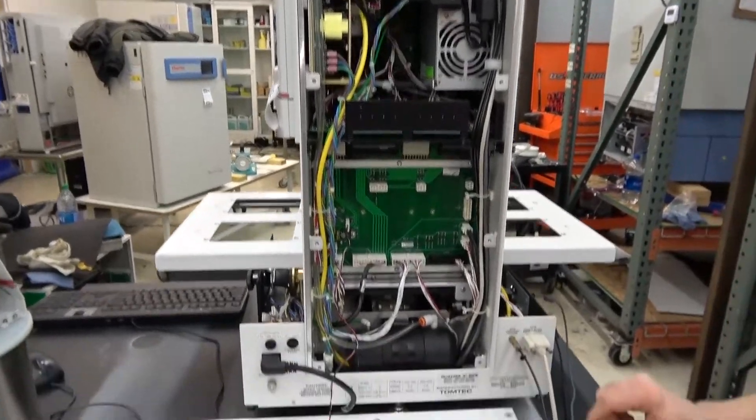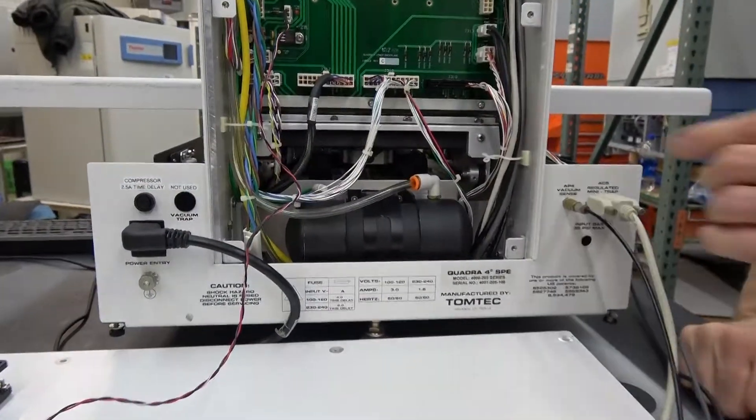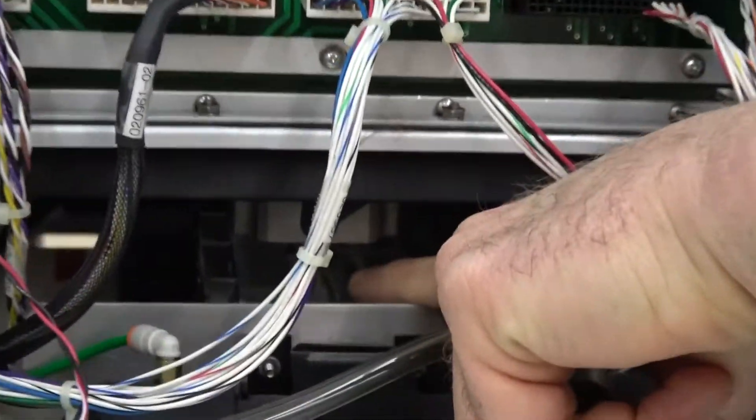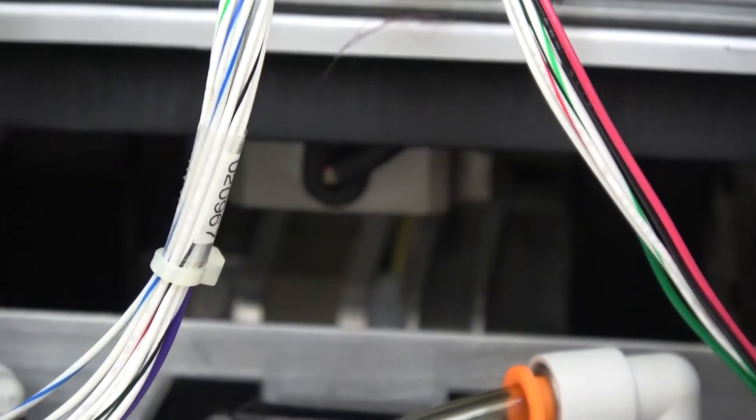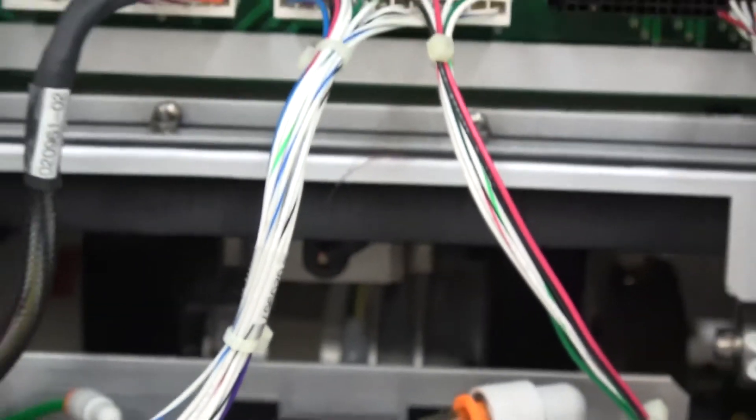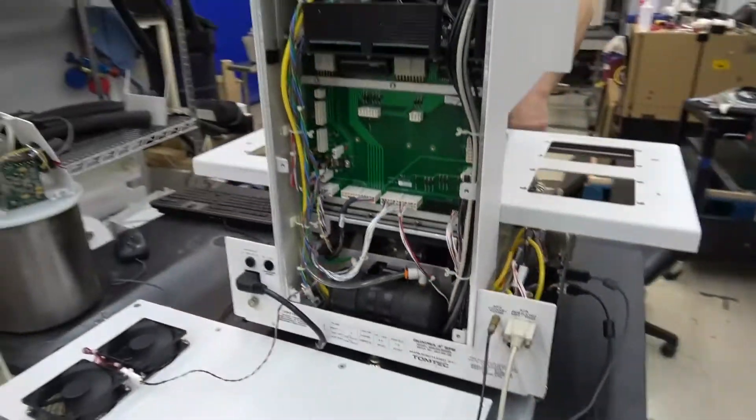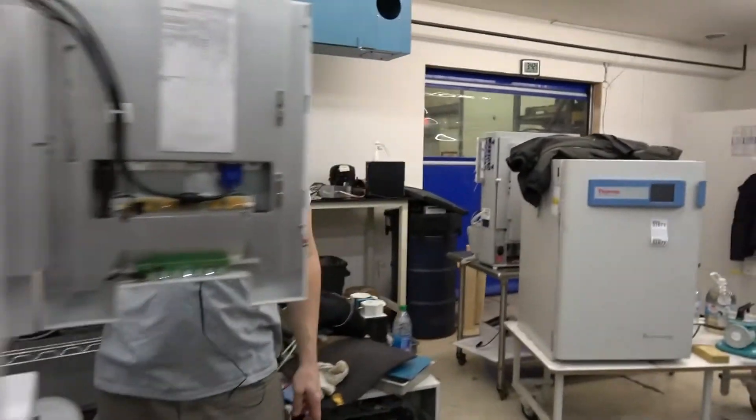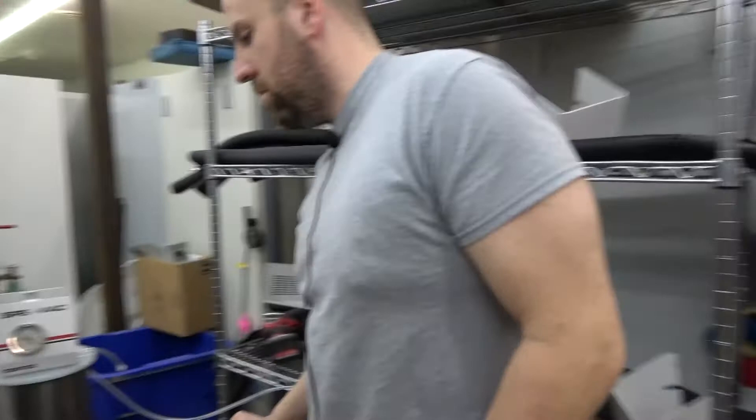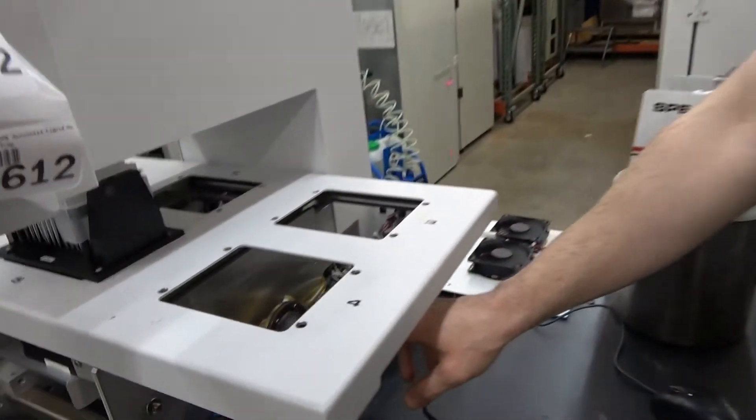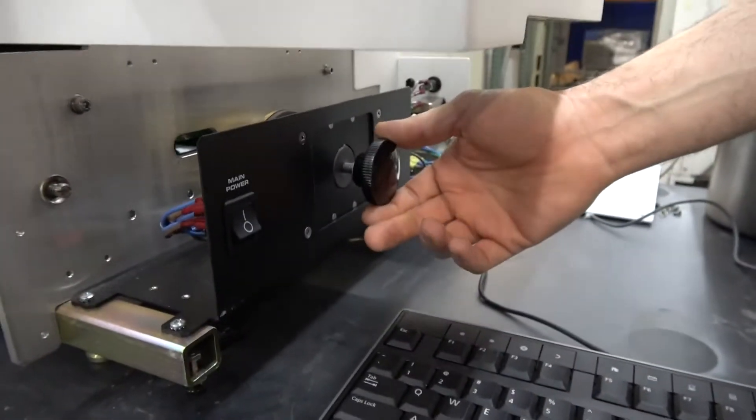If you get down in here, there's your air pump. You can probably see it from the front too. And over here is your pressure regulator for the pump.